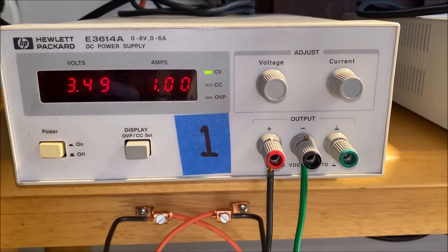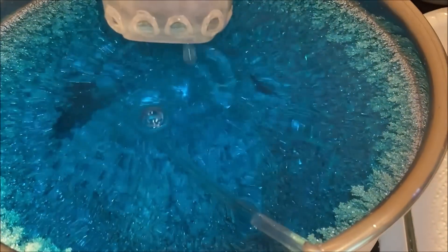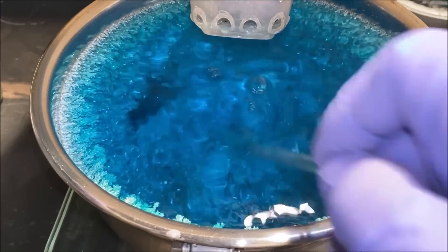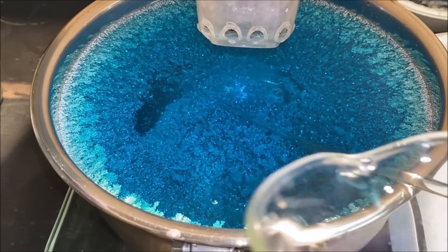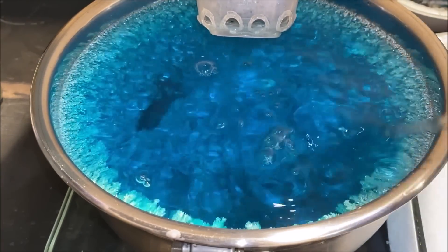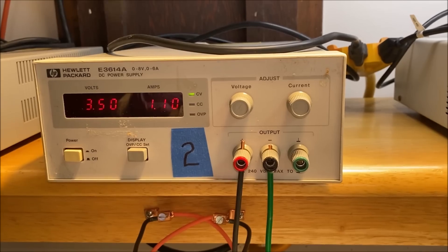The basket is still full of impure silver shot. Let's take a look down in here and see exactly what we've got. This cell looks like it's got more in it — it appears to have a little bit more than the other one. Give it a shot of electrolyte. Current flow on this one is just over one amp — that's silver cell number two.